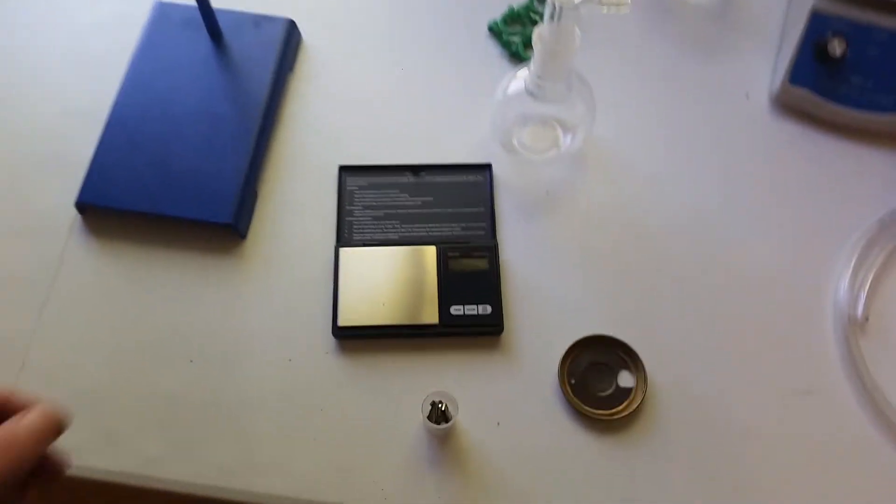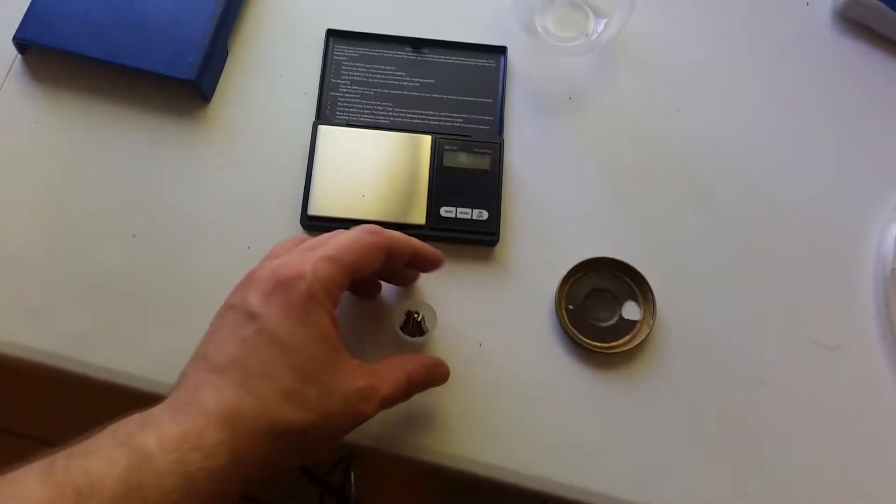Hey guys, so today we are going to be doing a reaction I read about online, where we can react hydrogen with neodymium magnets.